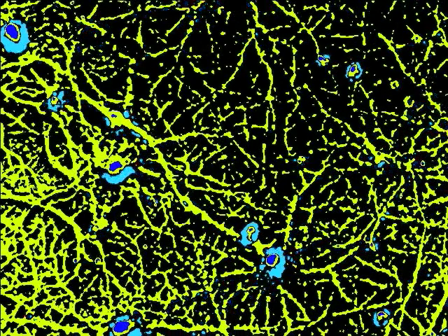We start by using a thresholding algorithm to determine the location of the cell body. The phase contrast image is converted to a binarized map of obstacles. Noise is removed from the image by using a particle size filter, and the obstacles are further dilated to ensure that robots do not collide with cells.